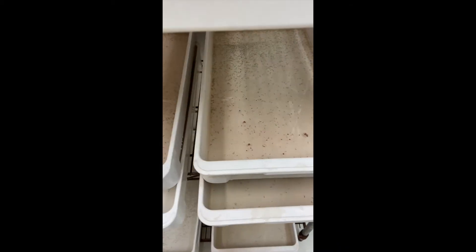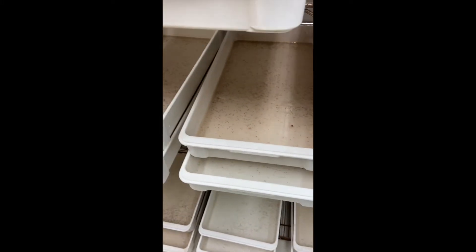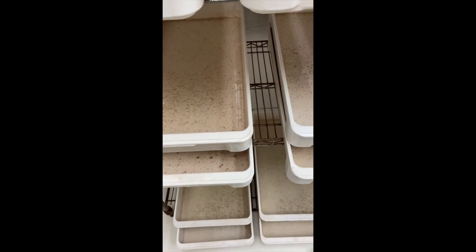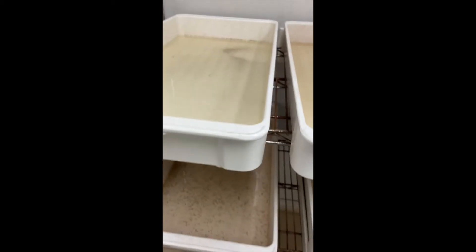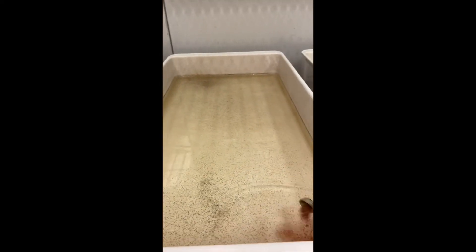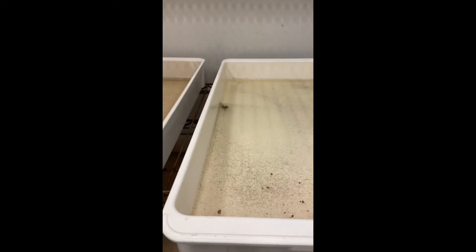You just do that for every tray. For the small larvae, you also feed them ground-up fish food every day, Monday through Thursday, but they get the small scoop — the one-eighth teaspoon scoop. We have four trays of them up here because we split them yesterday, so they get an even scoop of the small one. They'll be all good until tomorrow.